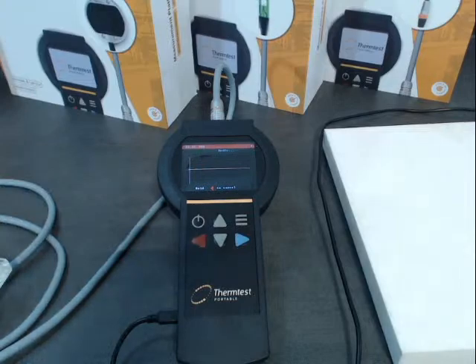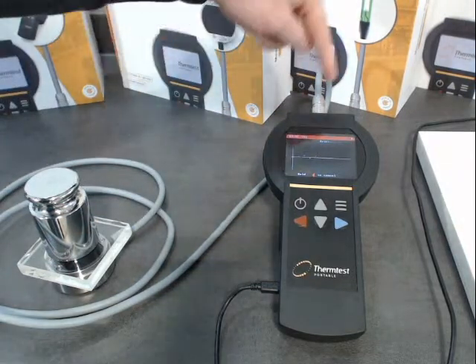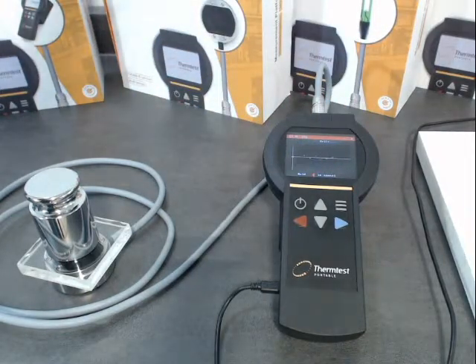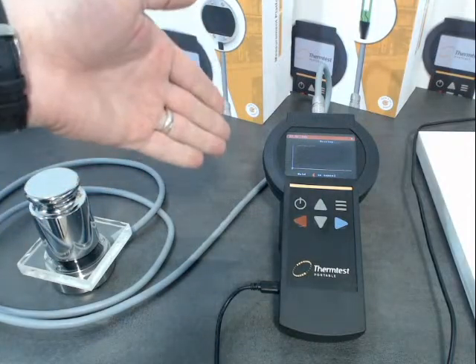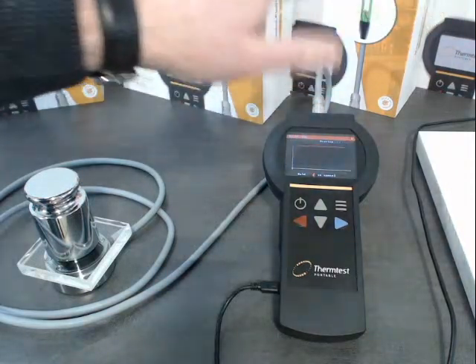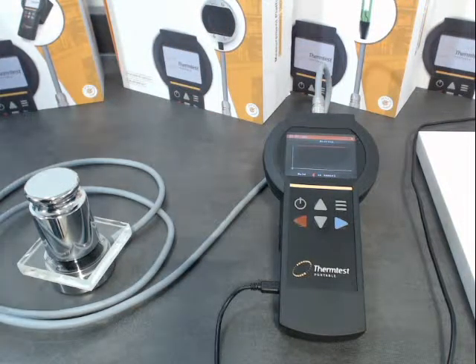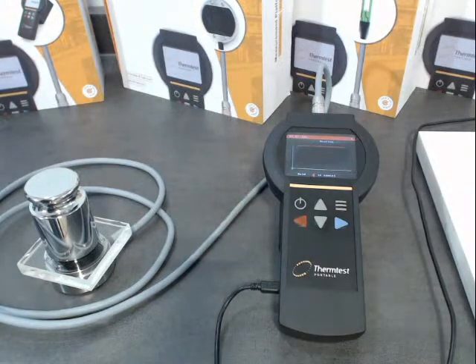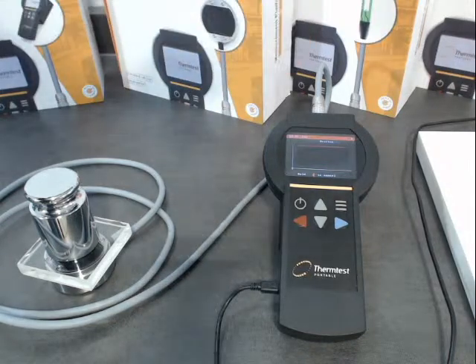In advance of every measurement — the sensor is auto-detected so it knows what's connected to it. It measures a 10-second drift; what it's looking for at the sensor level is isothermal conditions. Once it's done that 10 seconds, you're looking for a nice random scatter with no trends. It then applies power to the sample. What you see there is not clipping — it's actually a scaling because the temperature rise is going out of the graph. But once that's done, we can review the data and look at the auto-scaled graph to see the transient.